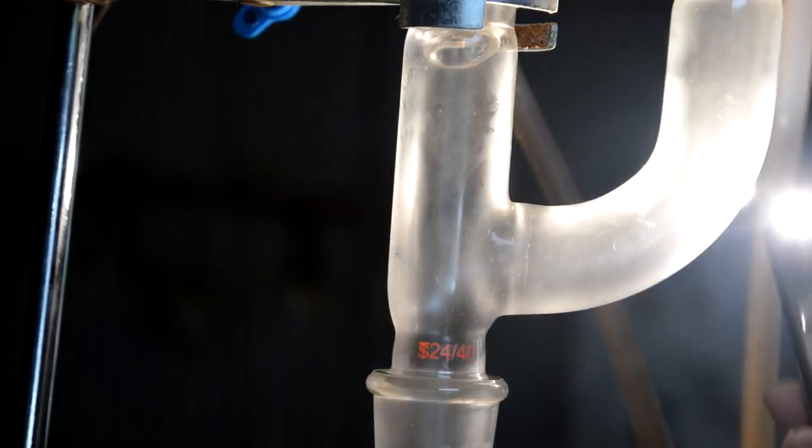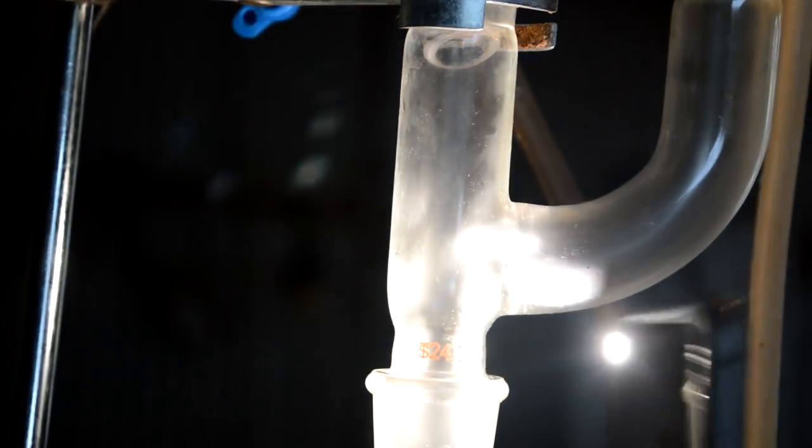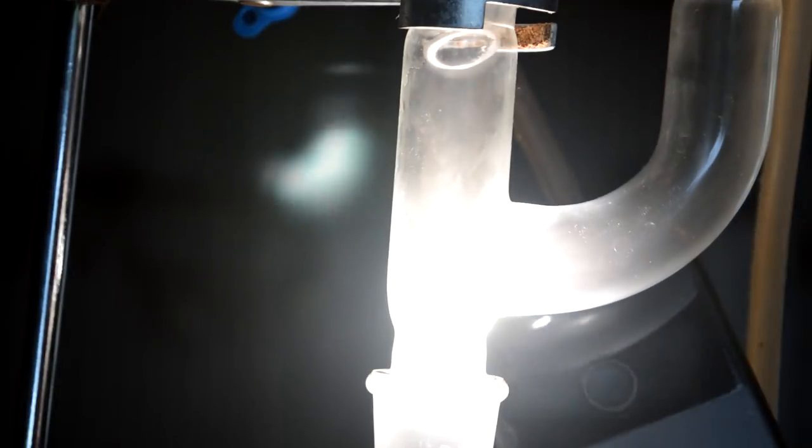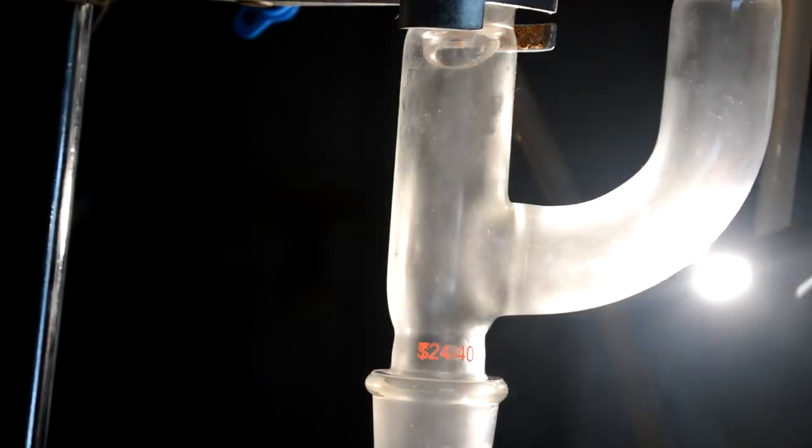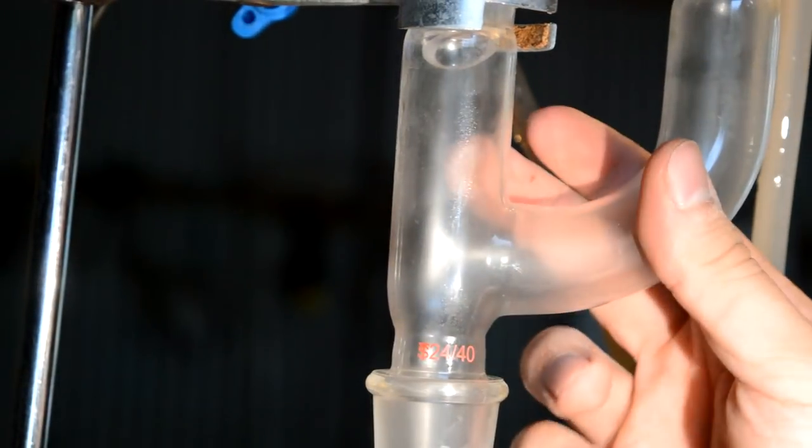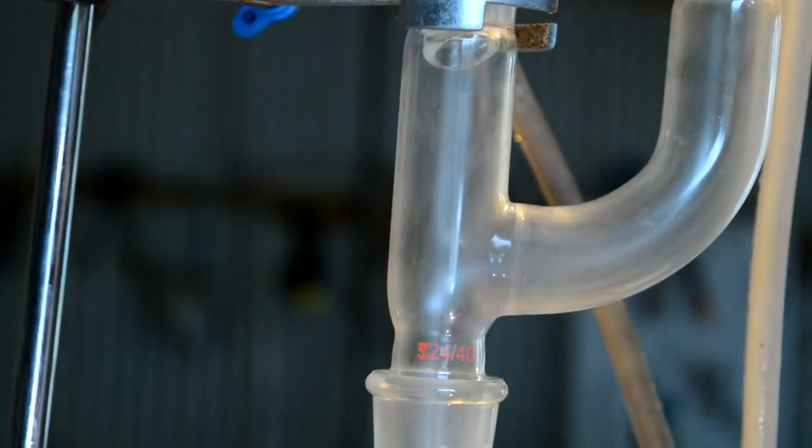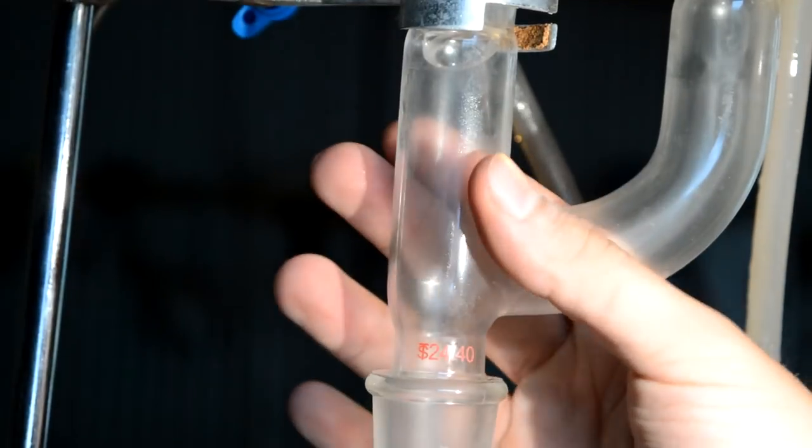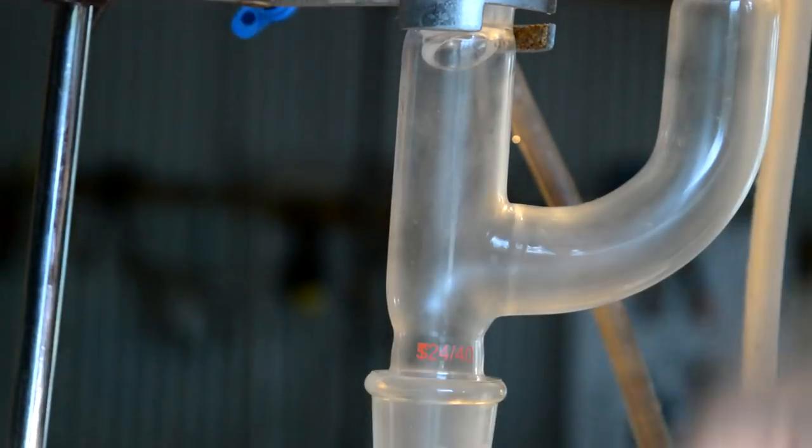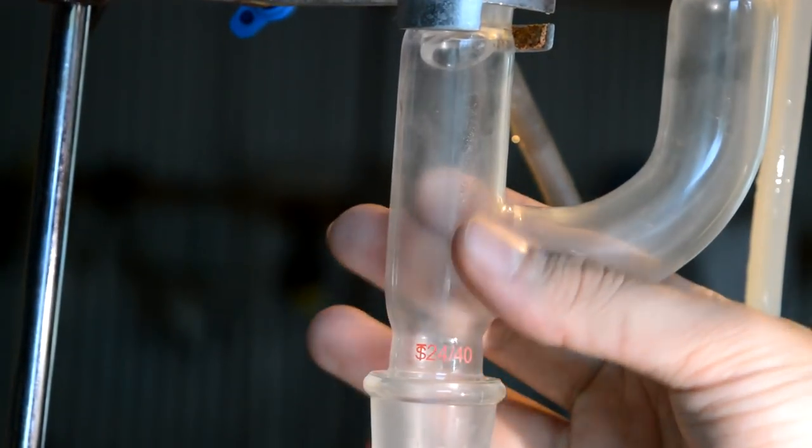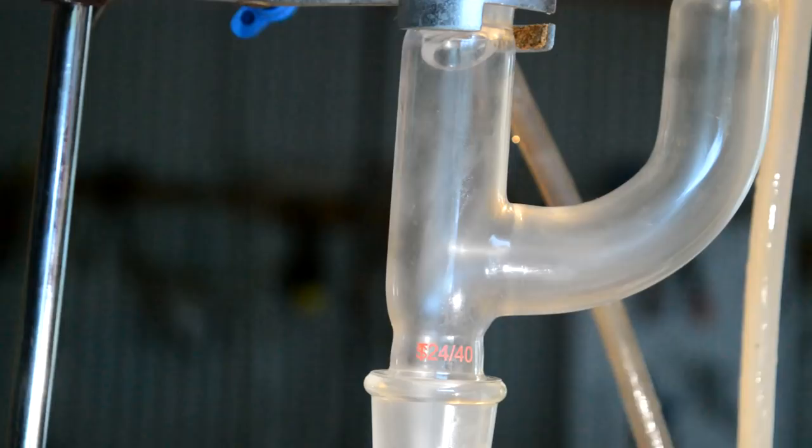All right, it is working kind of. You can see this is covered in little tiny droplets. We're making progress, but it's been about 40 minutes, so this is very slow. It does seem to be reacting where we want it to be. I expect it to, when it's actually properly reacting, heat up the glass, wherever it's reacting, quite a lot. If it's hot down in the isobutene outlet, which is down at the bottom, we know we really should be putting more isobutene in.